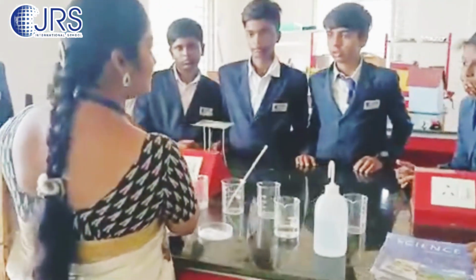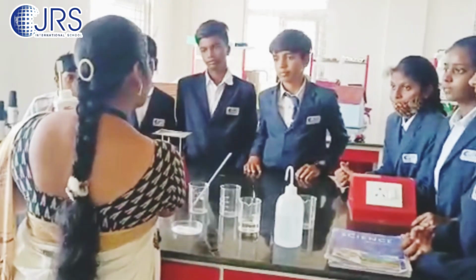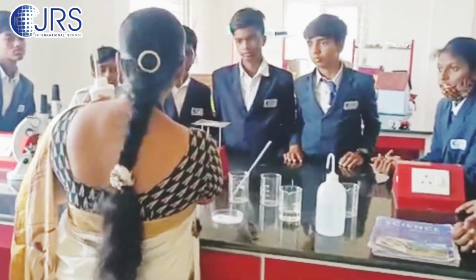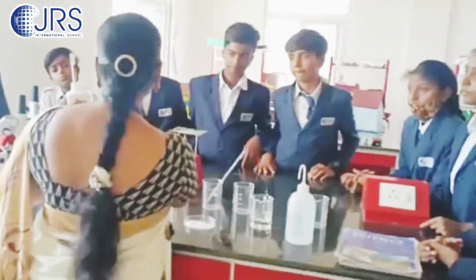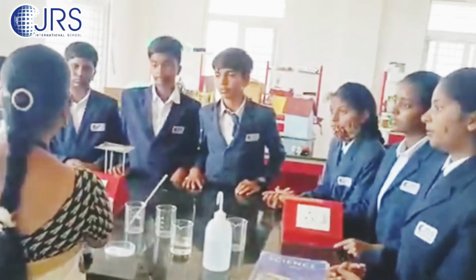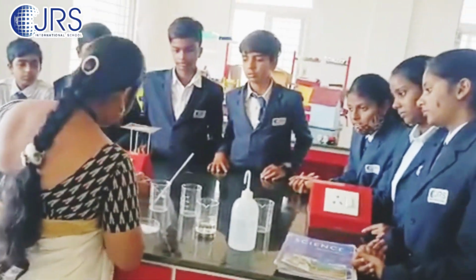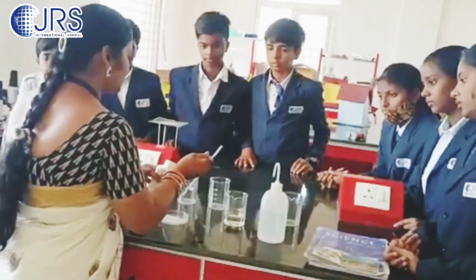We read yesterday symbols and elements, no? Potassium is represented with the K. Manganese is represented with Mn, and oxygen is represented with O. So all together this compound name is potassium permanganate, and it has a molecular formula of KMnO4. See here it will be in the form of purple color.